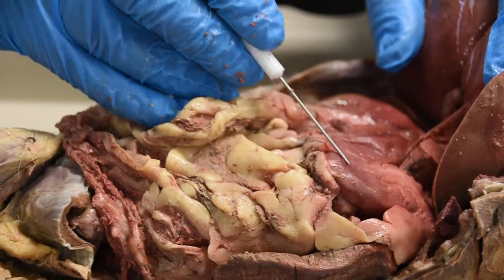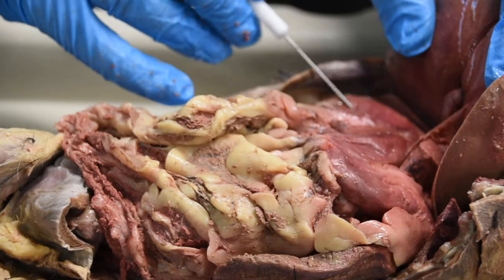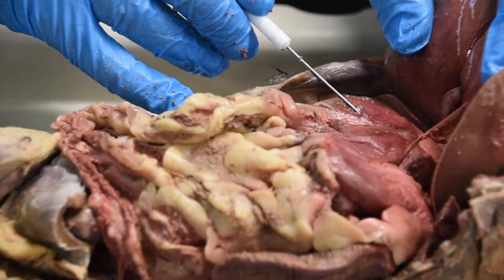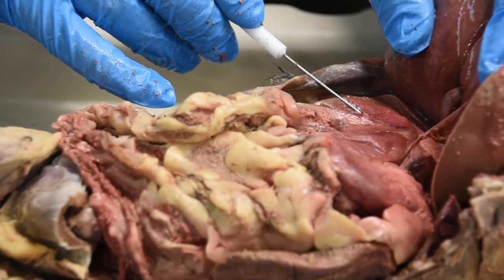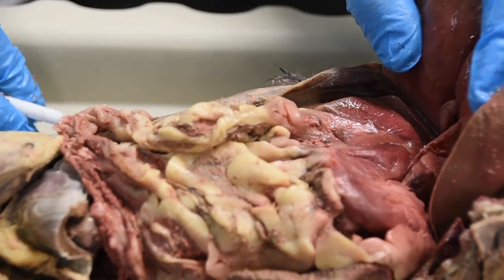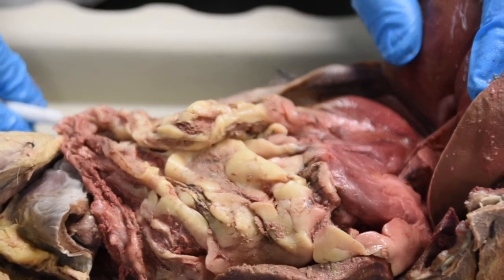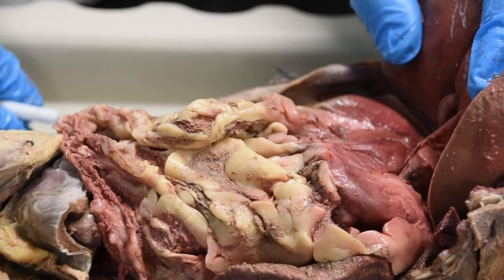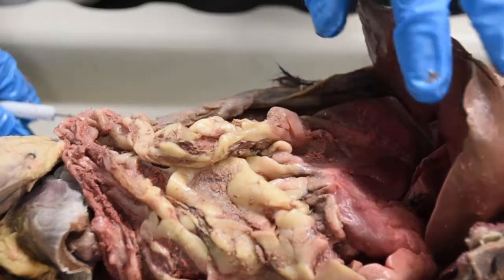Now the stomach is connected to the first part of the small intestine, which is right here. This is going to be your duodenum. Like in humans, this is relatively short and directly connected to your stomach. There is a valve that separates them. I'm not depicting it here, but you have seen it in the models for the human digestive system: the pyloric sphincter.